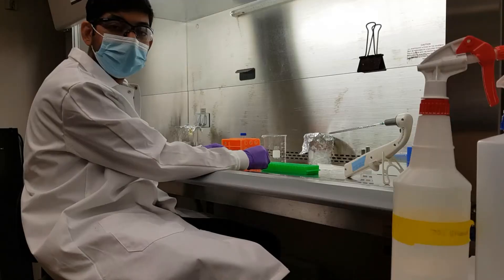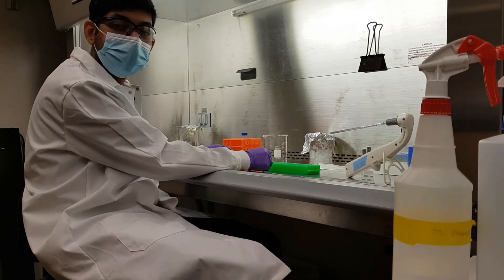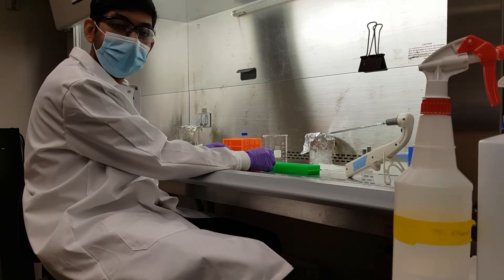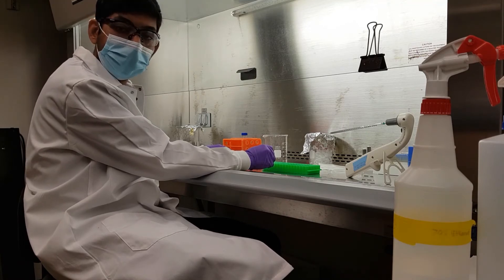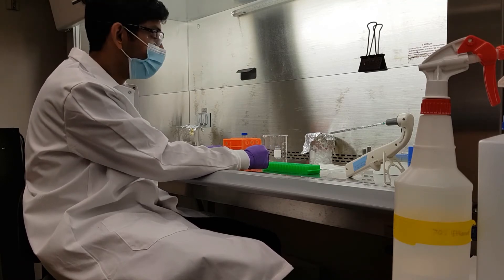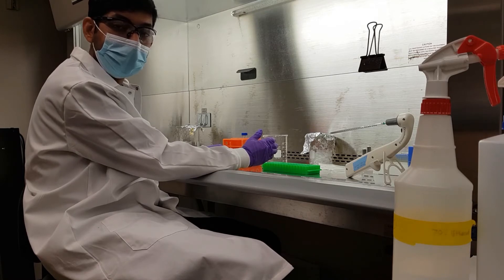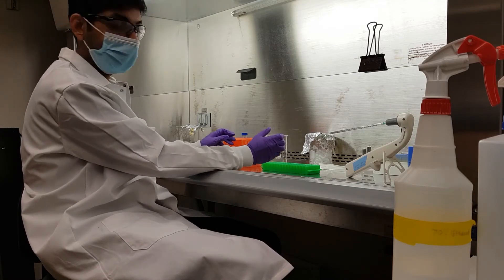A crucial step in our research is to test the efficacy of our nanomedicine on biological models. One way to do this is via cell culture work. Cell culture work is to be done in an extremely sterile environment such as the biosafety cabinet which we have.